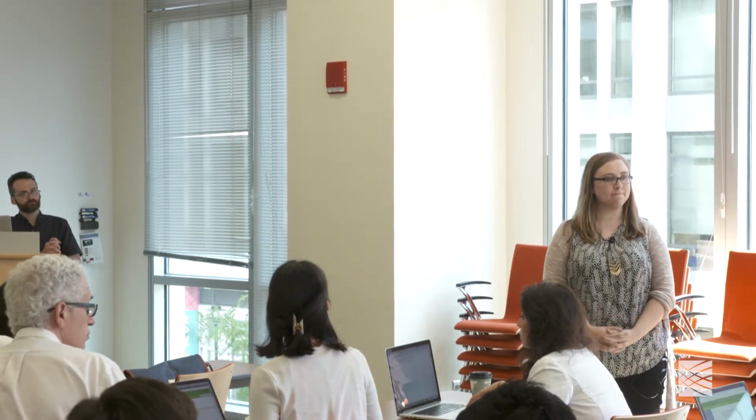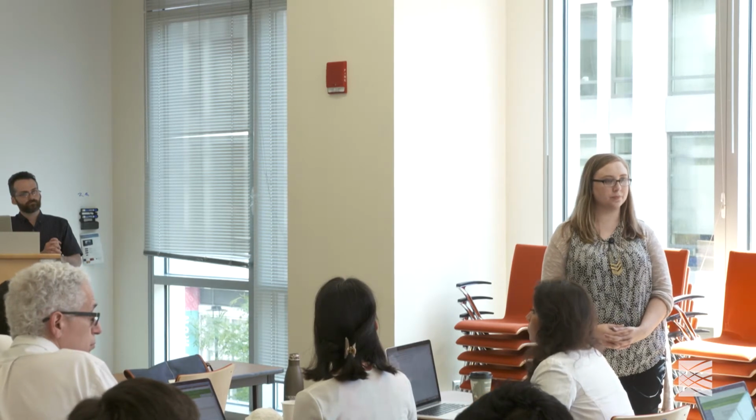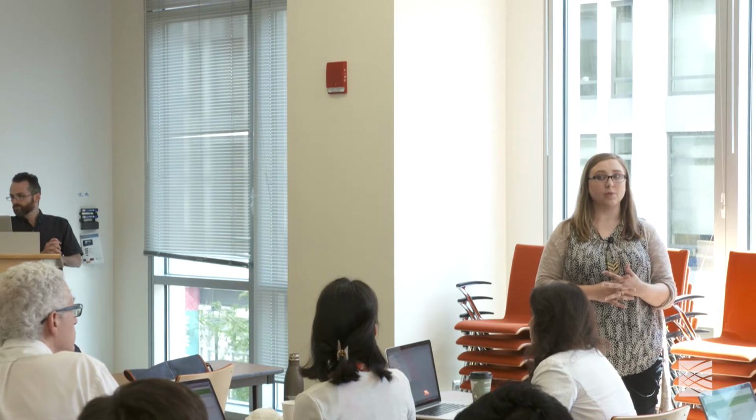But it sounds like you would want to delete it, otherwise you're going to be paying. Like, you use it for one type of analysis, and then you don't expect to do that analysis for another month. You would likely want to delete it and then restart it at some point in a month. Right? Yeah, you can absolutely do that. I will say the cost of keeping it in sleep mode is like $0.01 an hour, so it's very, very low. So if you think you might use it and you want to keep those files, you can, or you can delete it. It depends on what you want to do with it.